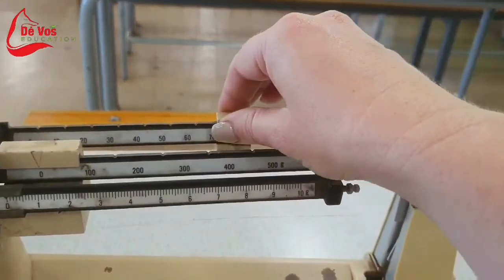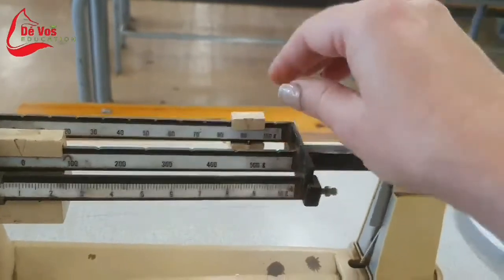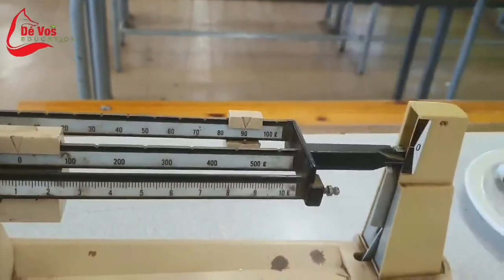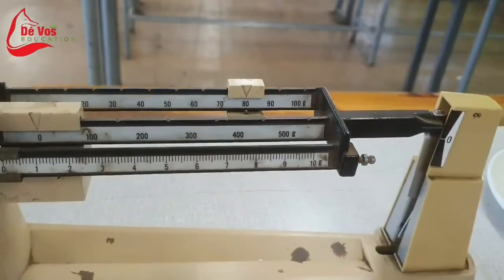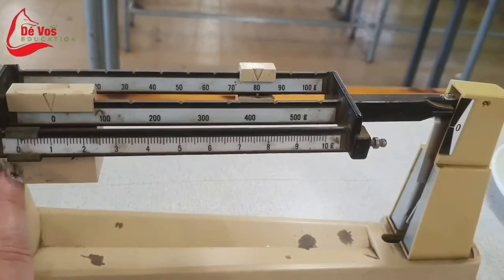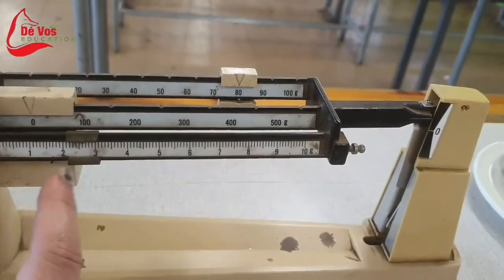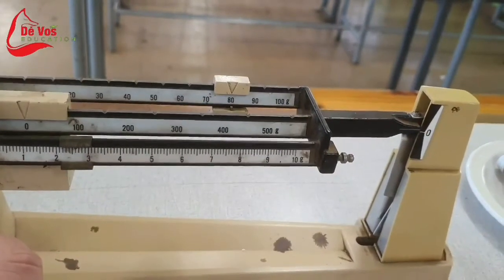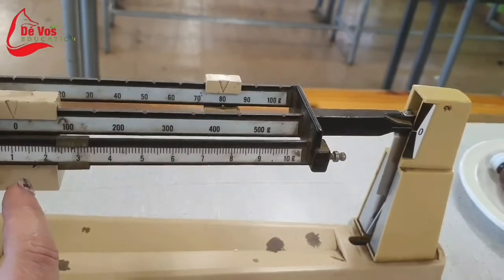So we started by moving the 100 grams and found that the egg is much lighter than 100. Next, we started moving the weight at the back, which is 10 grams at a time. 80 grams is still too light, but obviously 90 is too heavy. This means the egg must weigh between 80 and 90 grams. Now we move to the smallest weights at the front, moving them from left to right, adding weight as we move along.